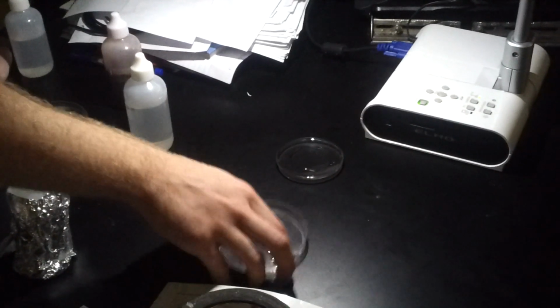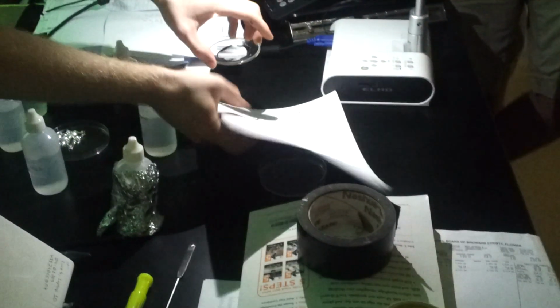You can see that because bromine is a brown liquid, but when it's in weak solution, it's just a little bit yellow. You want to put a white sheet of paper on it? Yeah, that should be best right about now. Oh, that's much better.